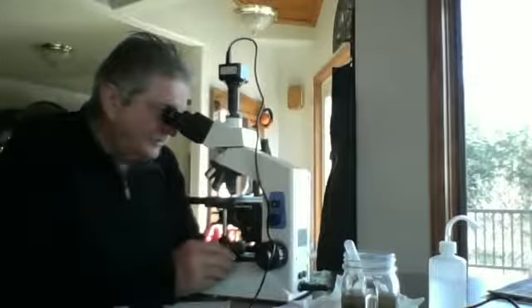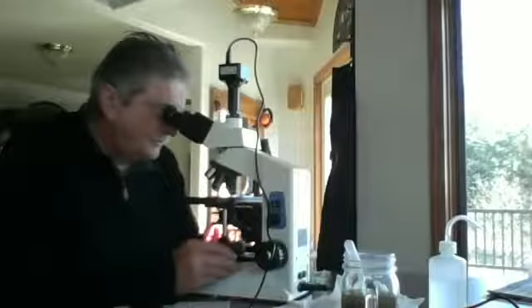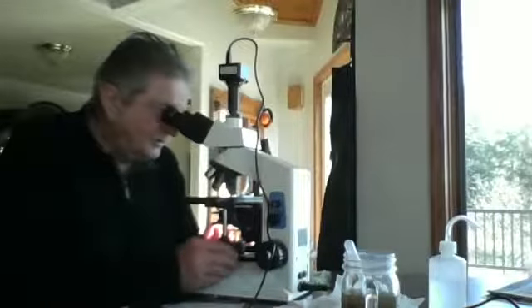But they have that irregular motion, and unmistakable. Now to field of view 3 and reading area 4.